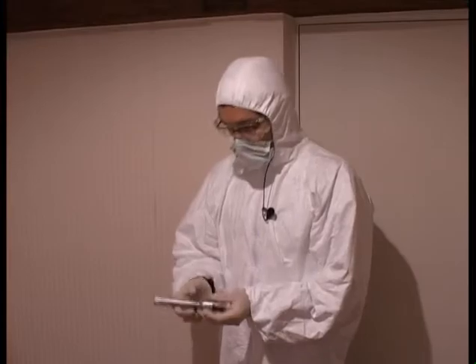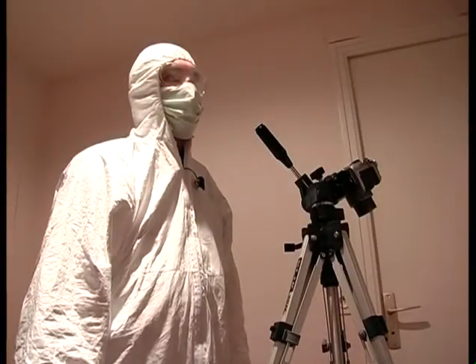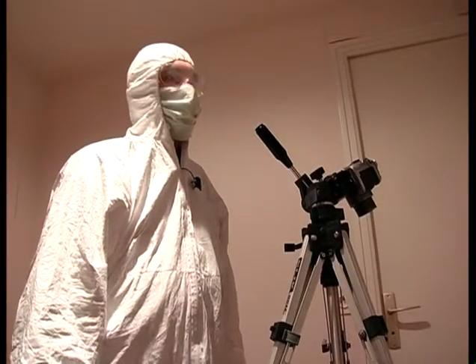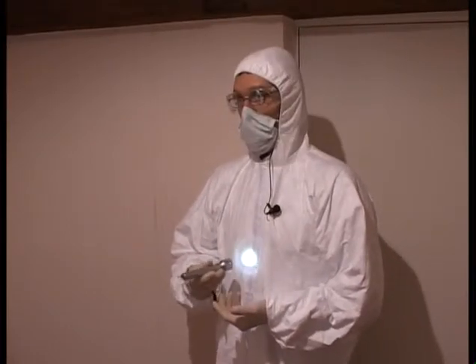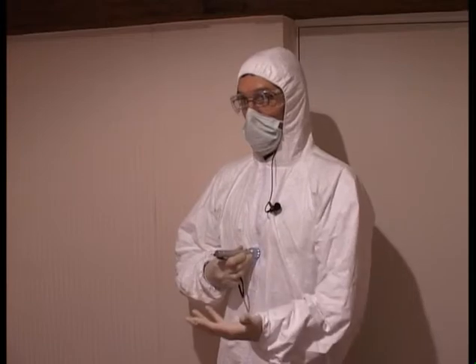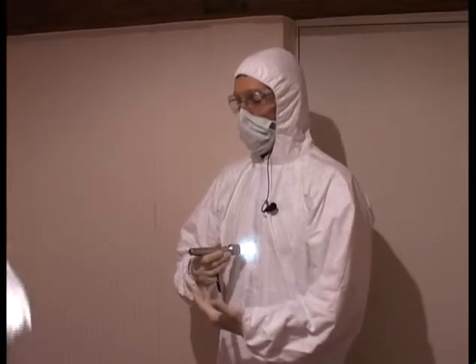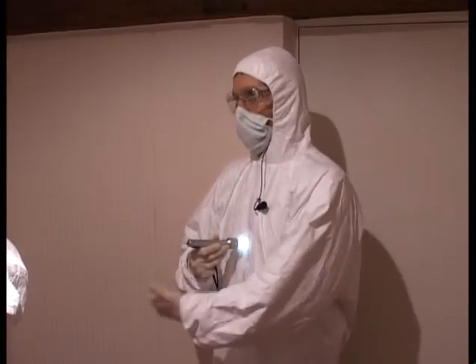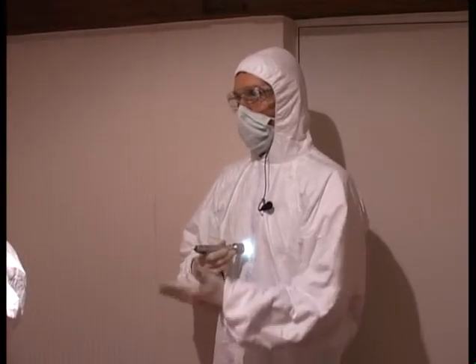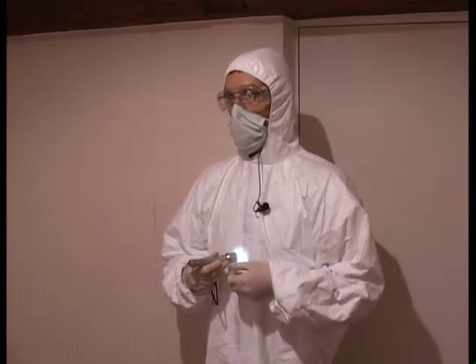So we will help ourselves by using a simple small torch that lets us add light. I will just light this torch and direct the beam at myself. No light appears in the zone when I hold the flashlight against myself. But the more I take it away from my body, the more incidental light there is in the zone. This means I will have adequate residual light for the photo to be taken correctly. This is how we will work now.